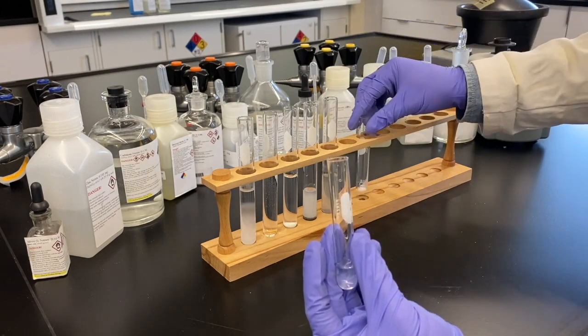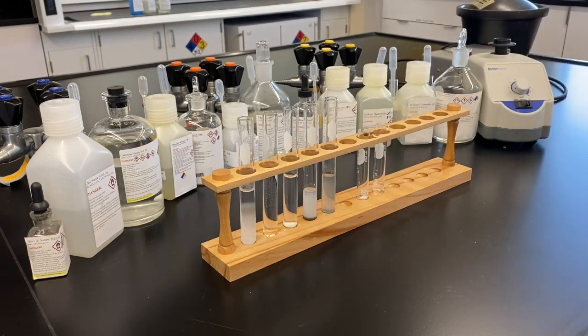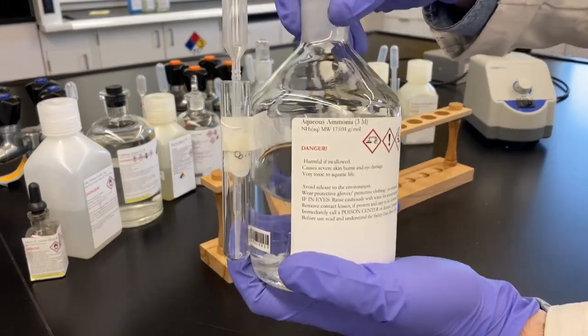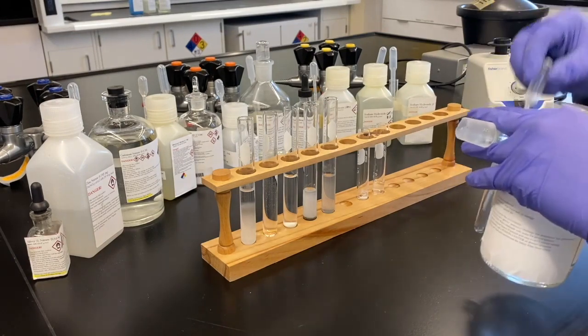Cool. And then that white precipitate that we've centrifuged down, that is the left side of the reaction. Yeah, we'll test that one with ammonia, and on the right side we'll test with sodium hydroxide. Cool. So just a process of elimination now. Our unknown for sure has 3 different ions in there. We just have to figure out what 3 they are.